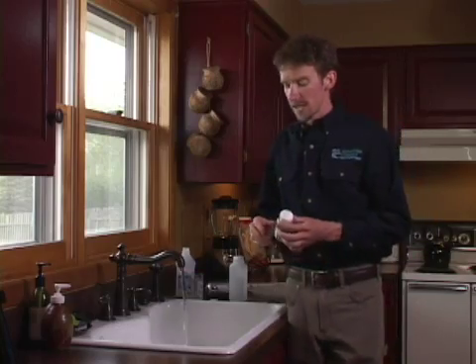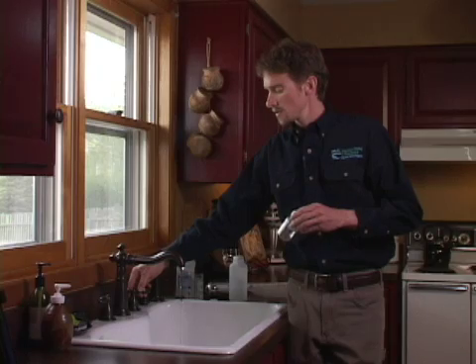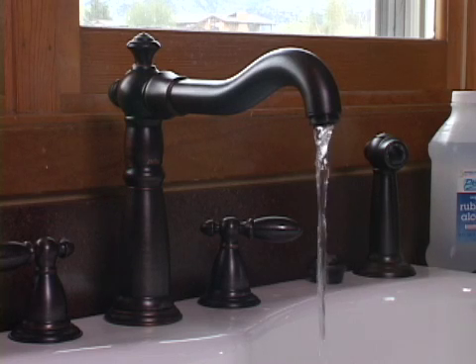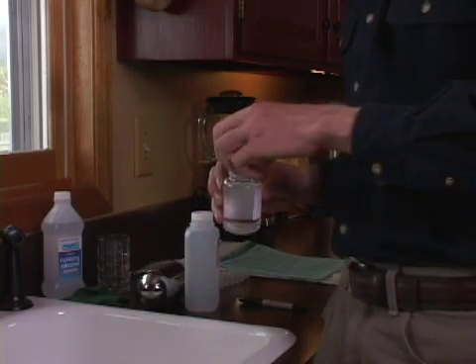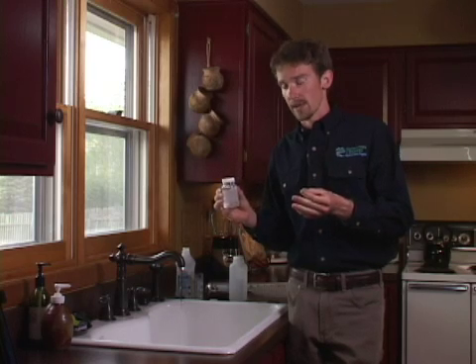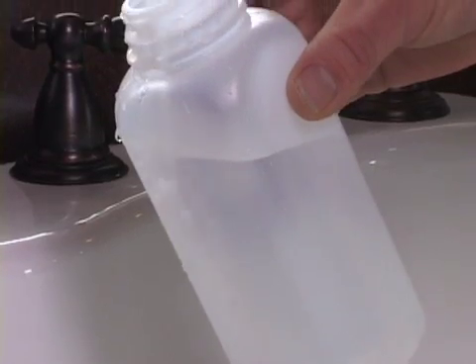Now that the line is flushed, I'm going to take the bacteria sample. First, I'll turn the stream down to a pencil-sized stream of water so I can easily fill the bottle. I'll then let the water flow for three to five minutes to allow any bacteria from adjusting the faucet to be flushed away. There's a white powder in the bottle which is a preservative, so I don't want to rinse it. I'll fill the bottle to the 100 ml line and recap it, being careful not to touch the inside of the bottle or the threads, as bacteria from fingers can give a false positive for total coliform.